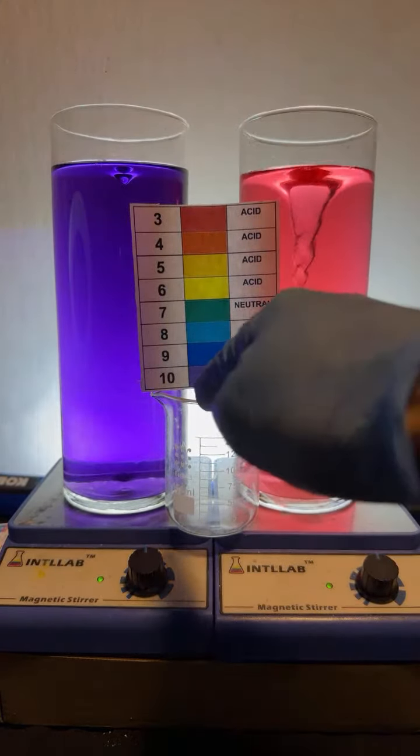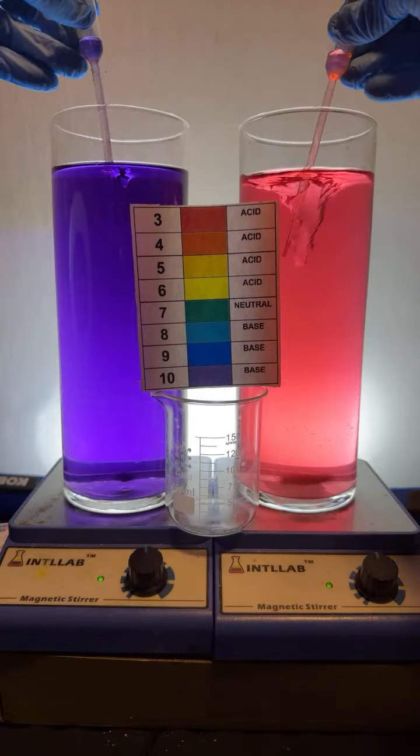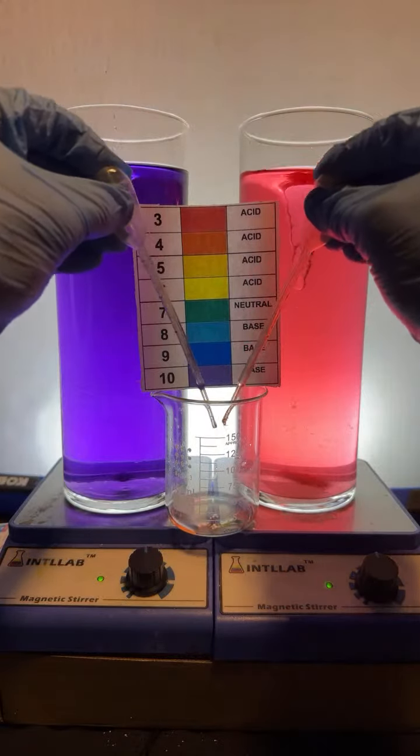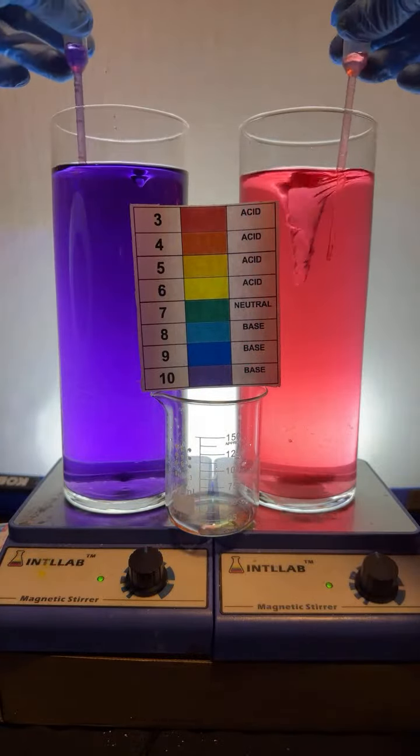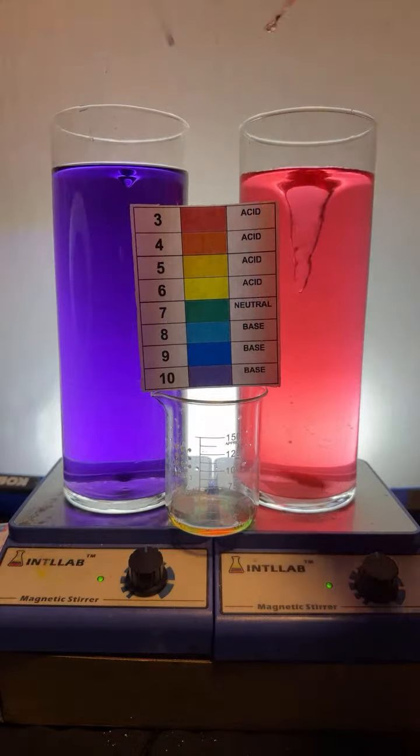All right, keep your eye here, this will be mixing it. Thank you for the suggestion. All right, so up here at the top, you can see I'm gonna pull out some purple. I'm gonna pull out some of the red. We're gonna mix them together. We'll do it a couple times here. Probably make a little bit of a mess. I usually have to clean up a little bit when I'm done.